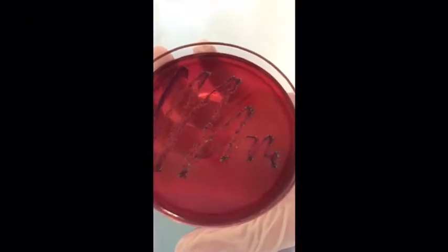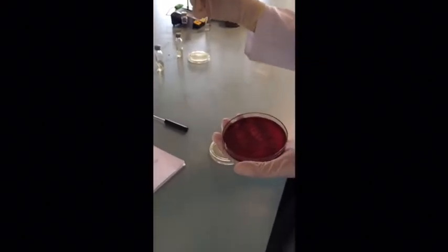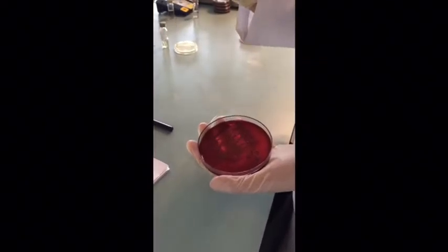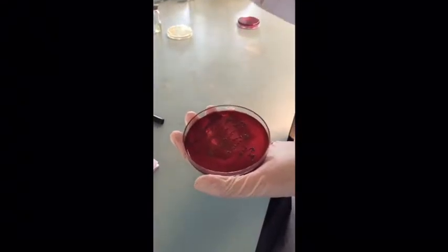Now we will proceed with the completed test, and we will choose the agar plate that exhibits a greenish metallic sheen. For the first step, we will perform the aseptic technique, that is, we will flame the wire loop over the Bunsen burner. And next we will isolate the coliform from the colony, and streak it onto the agar plate as well as the lactose broth.